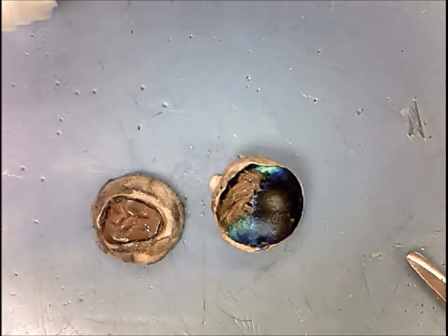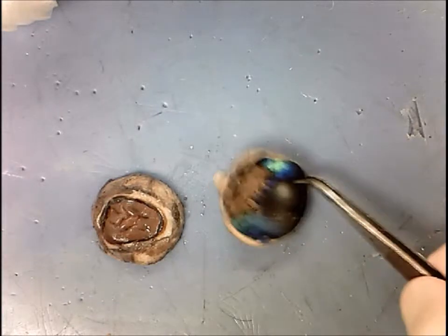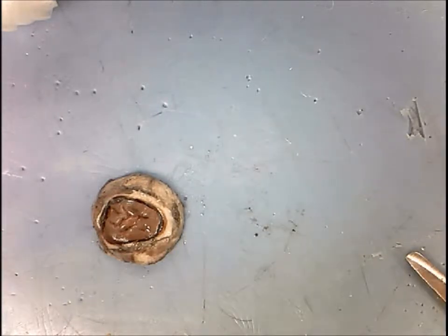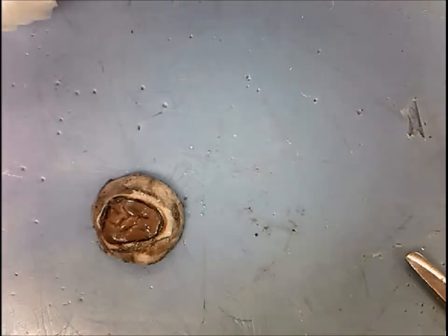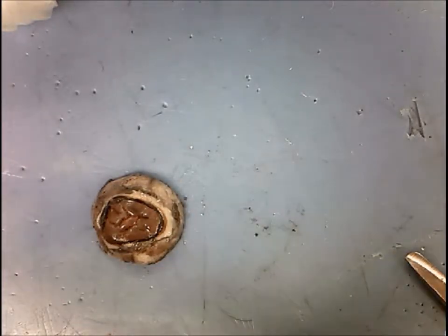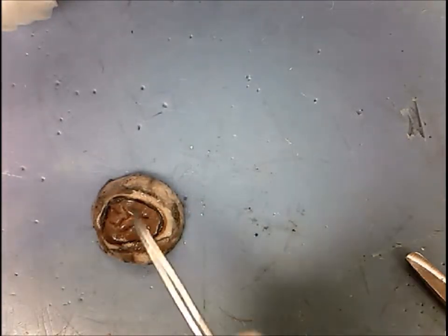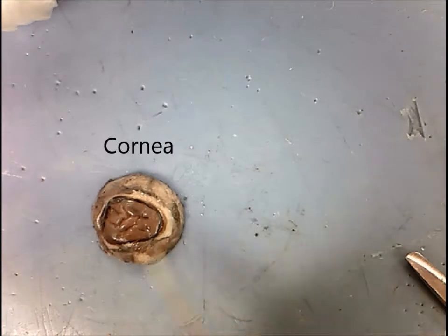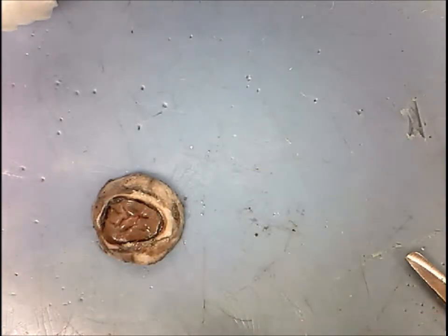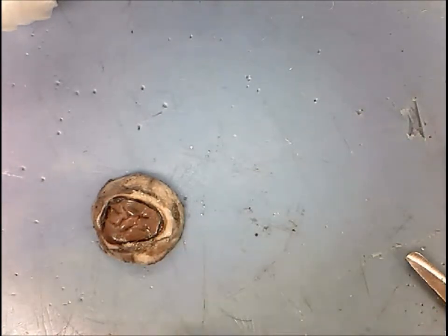Now that we've created two halves of the eye, we're going to take a look at the internal structures of the anterior eye. Looking at the anterior eye from an external view, you have the cornea, and underneath the cornea — which is not visible at this time — you have the iris and the pupil.